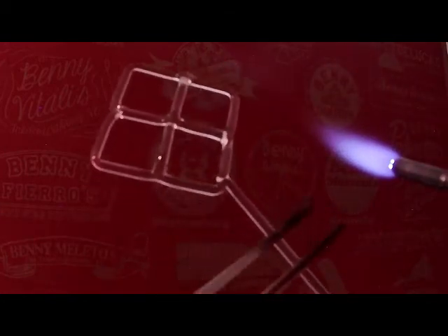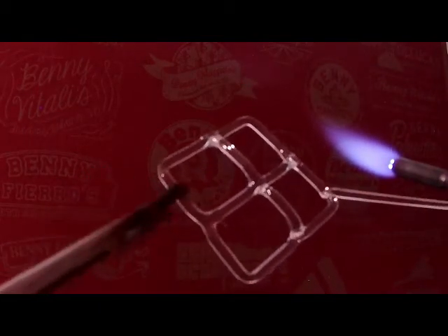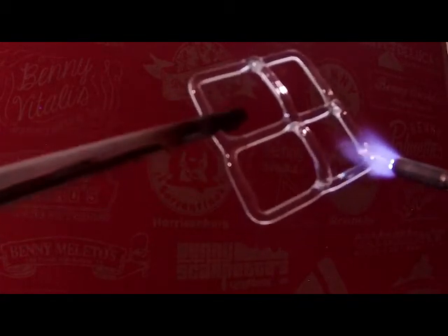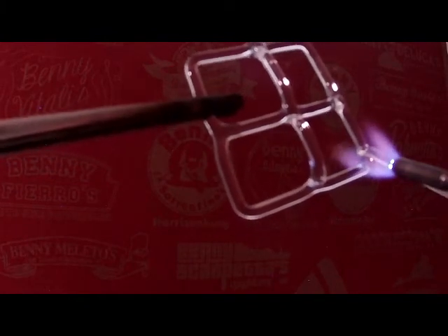For the sample holder, what I did was this punty, this connection rod, I kept it on till the end and actually bent it down, and it became one of the legs for holding the sample. I put a leg on each corner. But now I'm going to remove the punty. So I'm going to hold this with the tweezers and fire cut this off.